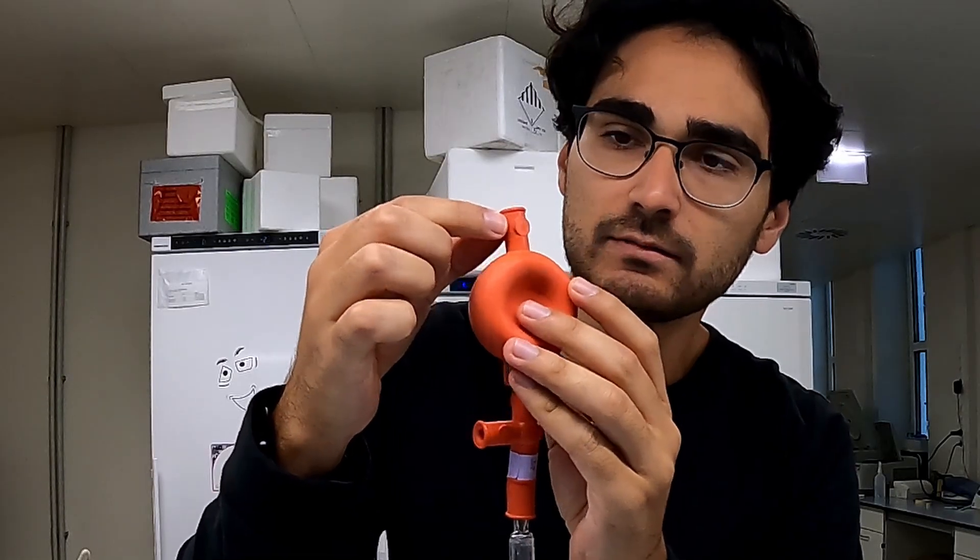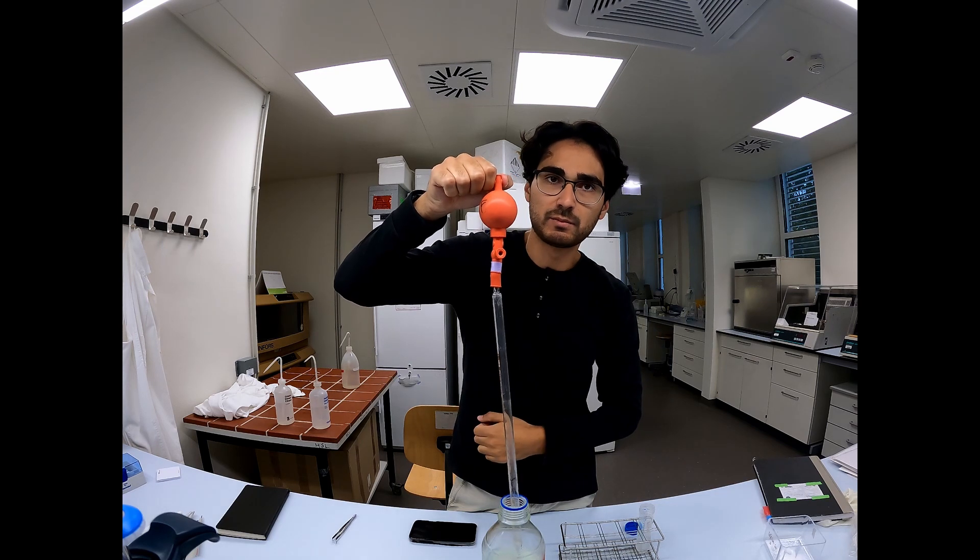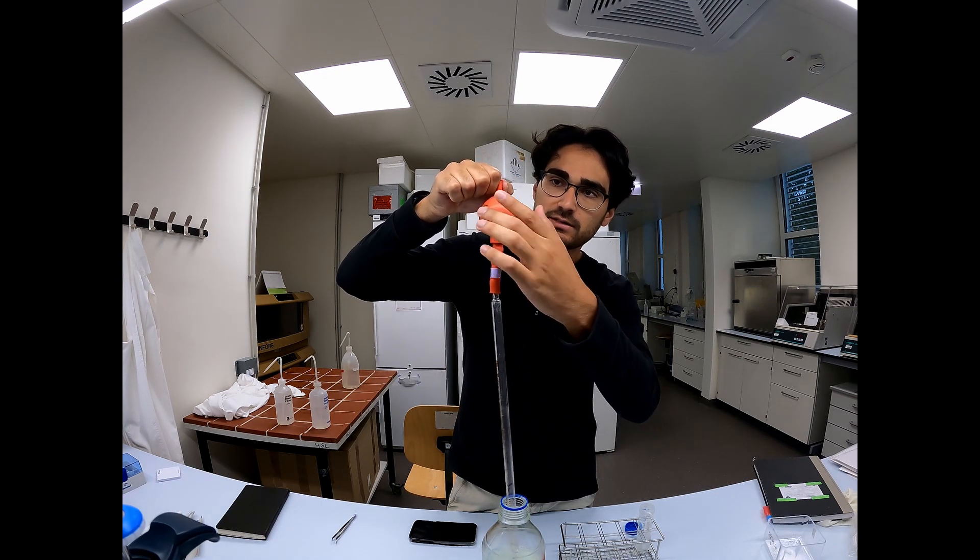Then you press A. You can inflate the balloon. If you keep it pressed, you can deflate it.